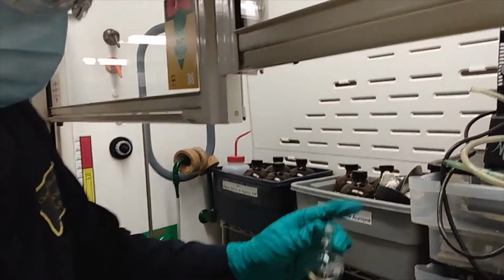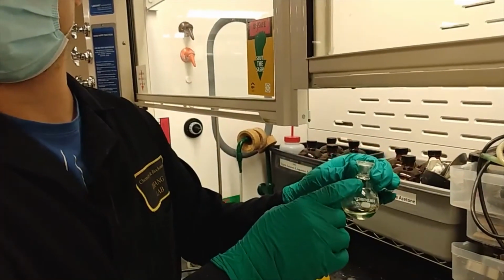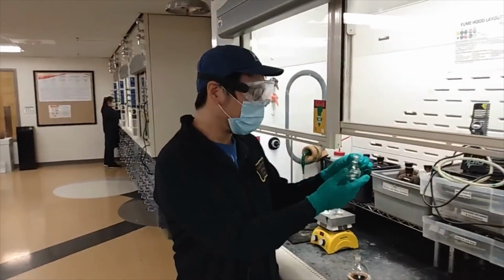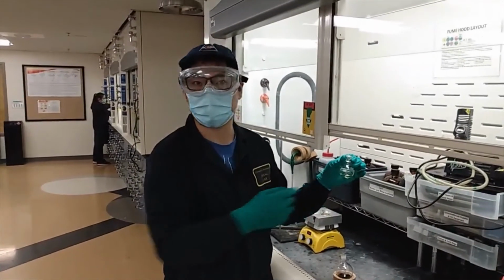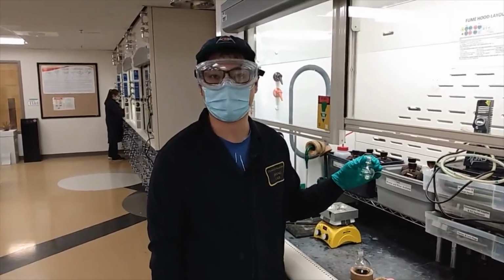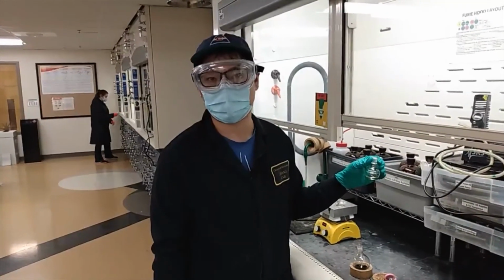And if you observe any of the palladium carbon going through the membrane filter, you will have to switch to another filter and do it one more time. And with the organic phase here, we will do one more extraction with the ether, combine the organic solution, and rotovap to concentrate it down. That will be our final product.